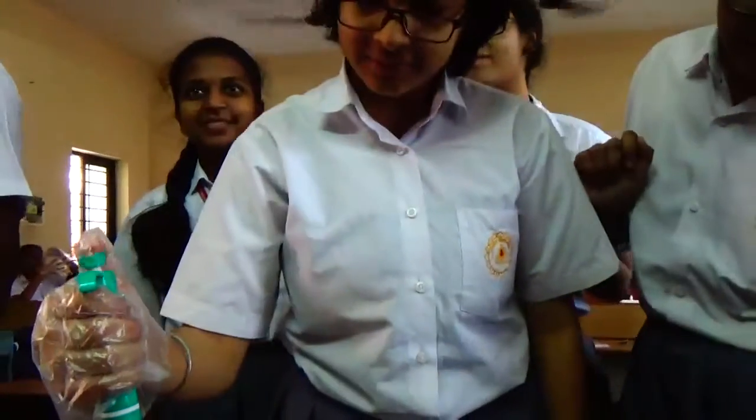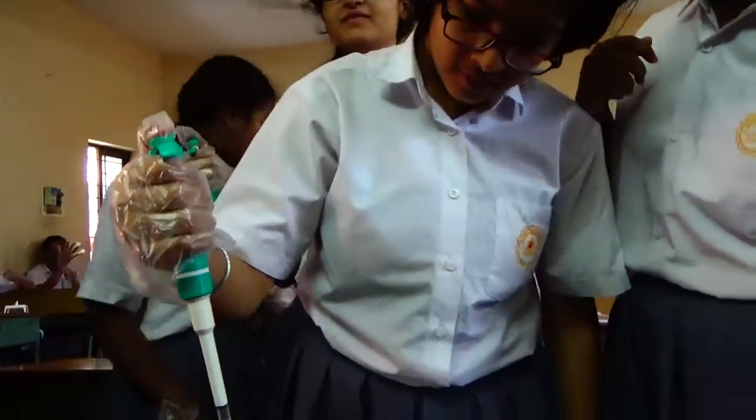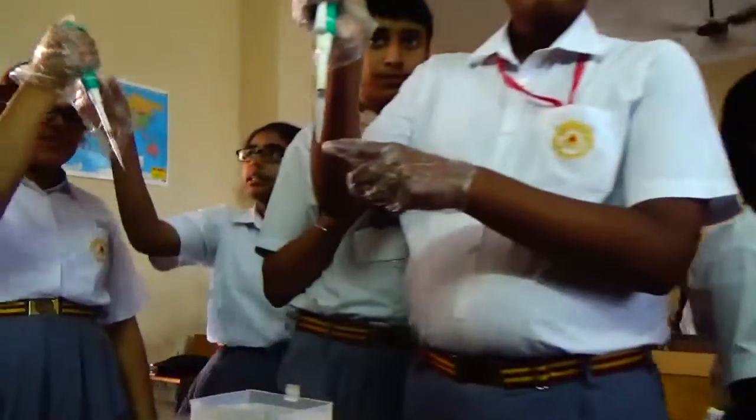Here more people can join. You also come. Come, yeah, try here. Yes. Drop the liquid.